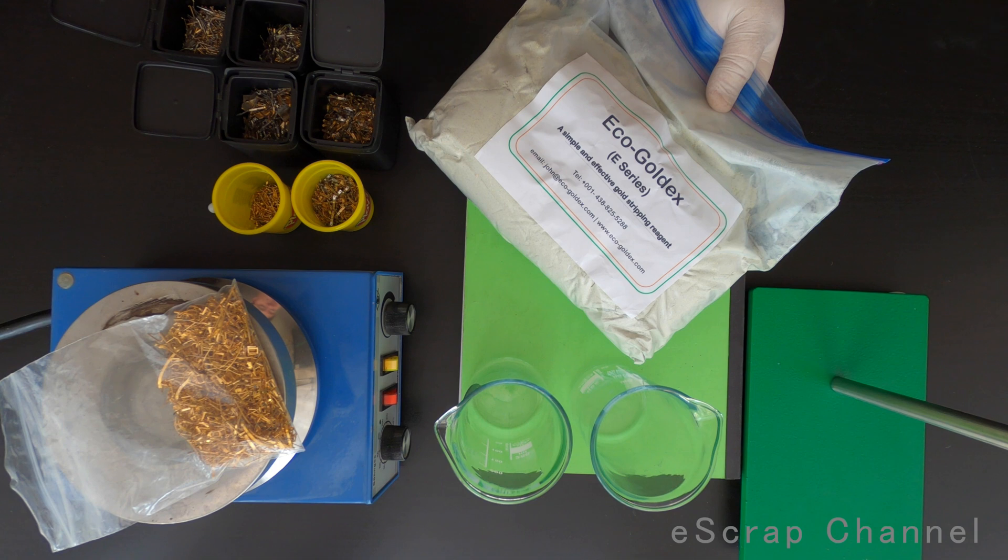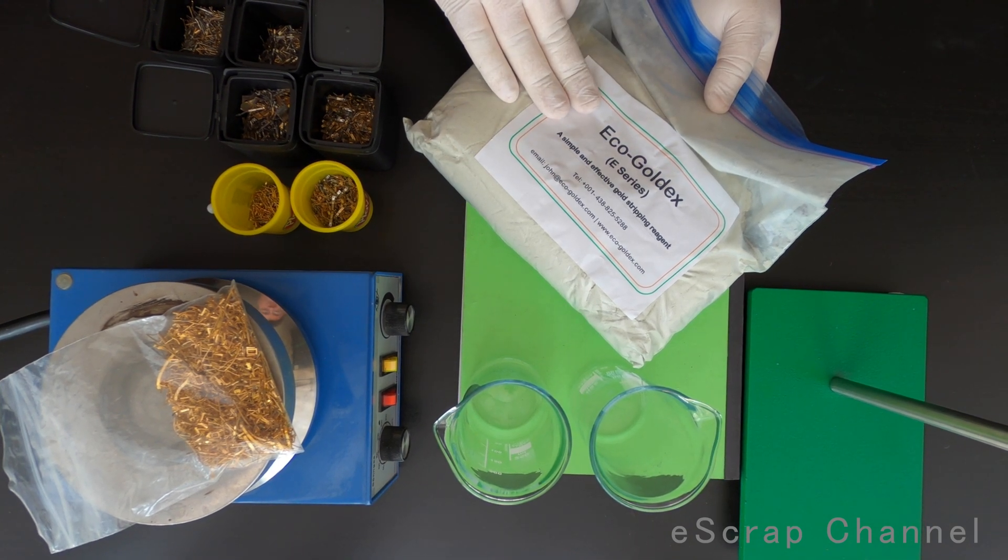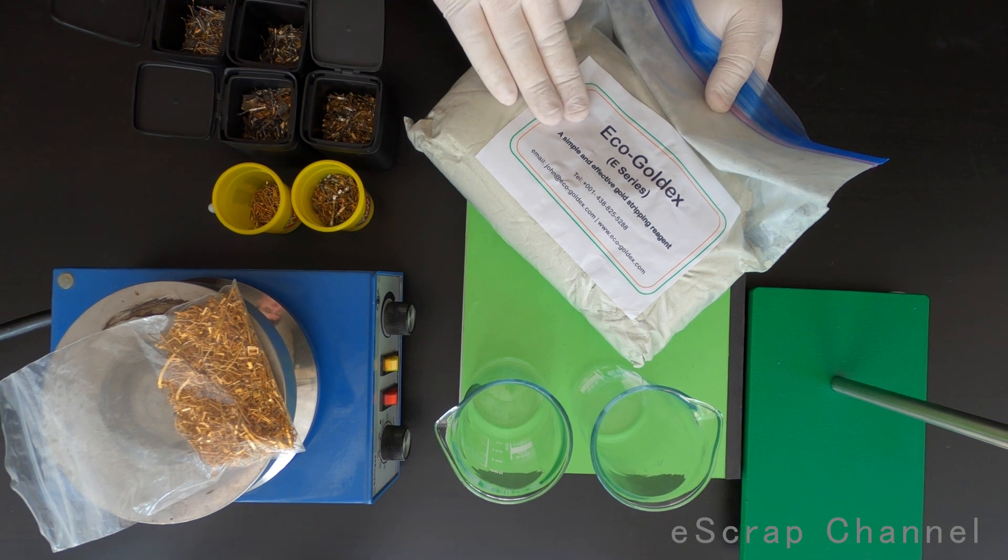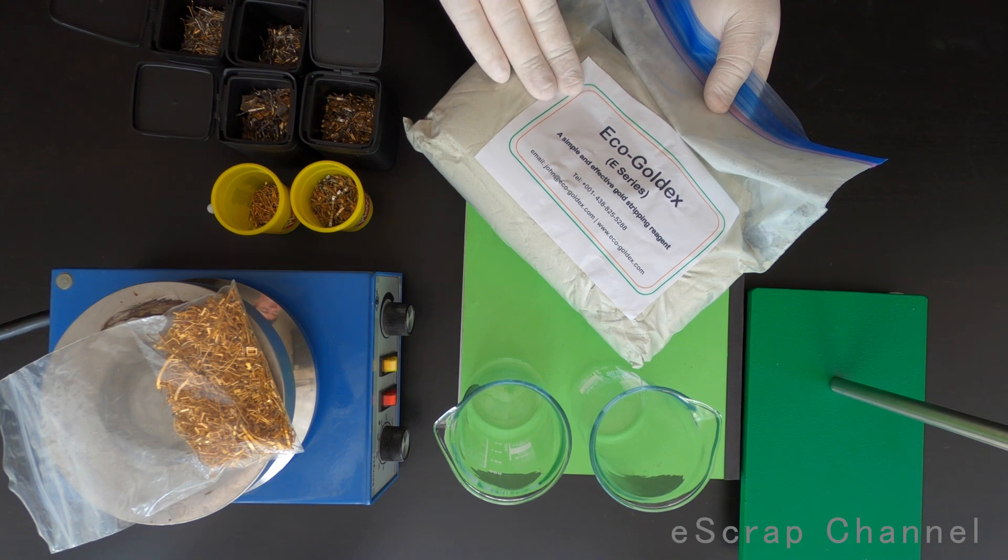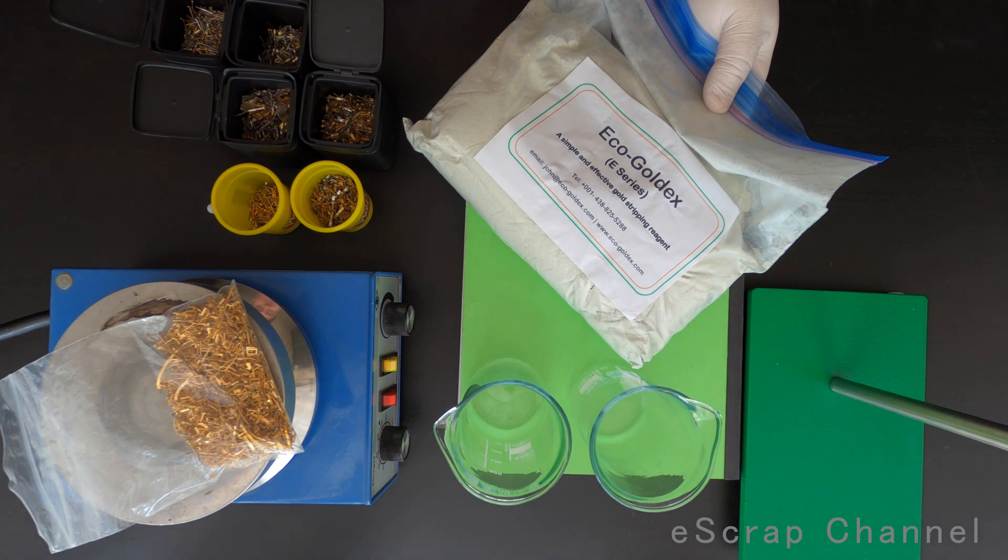This agent is supposed to be used at working temperature with best performance at about 50 degrees, so I can adjust this. I will use this setup and try to strip and recover some gold today.